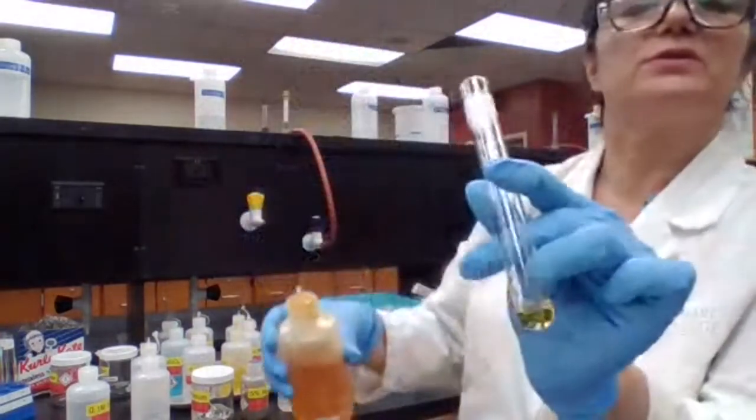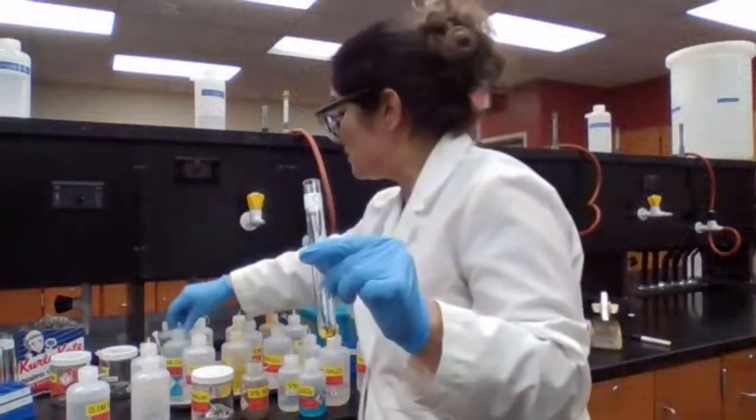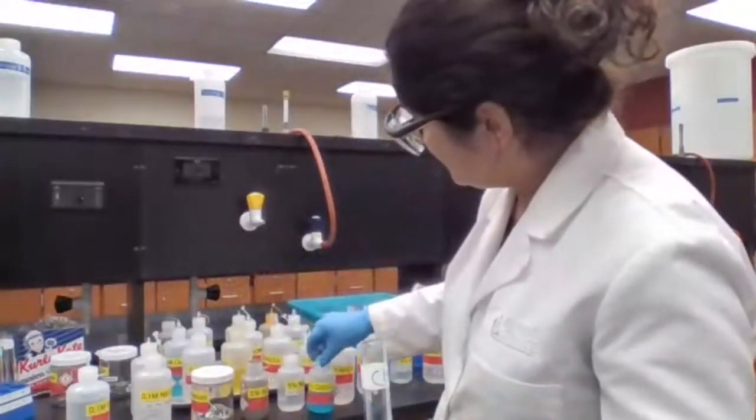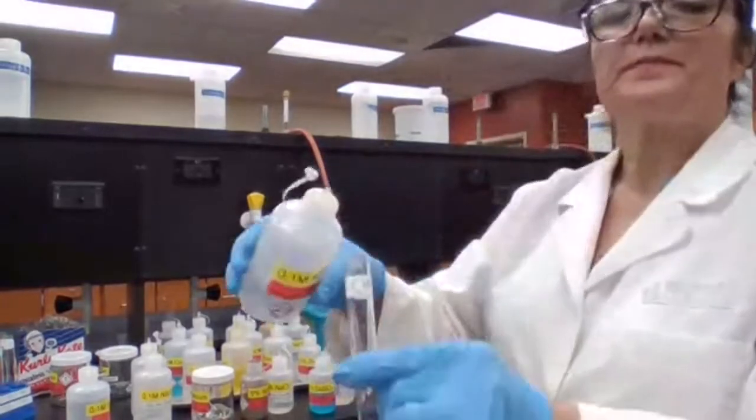Okay. Clear solution. And we want to add sodium hydroxide. We have it somewhere. Sodium hydroxide.